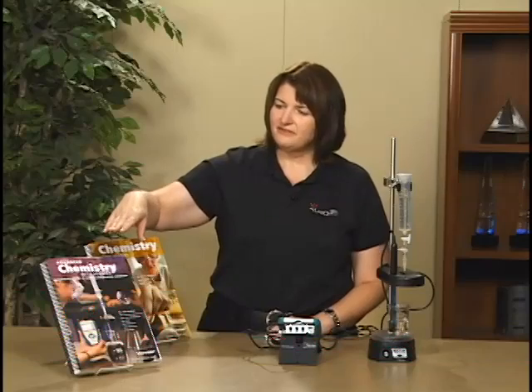This experiment is an acid-base titration. It is experiment number seven from the Advanced Chemistry with Vernier book written for college and AP chemistry students. It's also very similar to experiment 24 in the Chemistry with Vernier lab book that's written more for high school students. The lab is an acid-base titration with hydrochloric acid being titrated by sodium hydroxide.